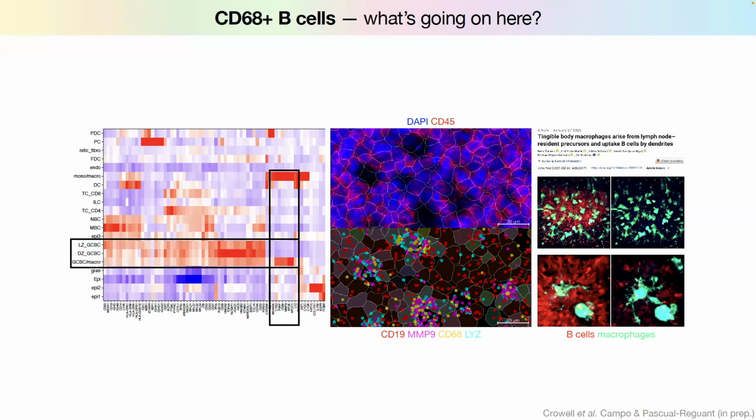But if you don't know about this and you only see this, what happens is that the transcripts are bleeding into cells that they don't belong to. So these macrophage genes that are being expressed are being assigned to the B cells after the segmentation. And then we get these weird mixture populations, right? And that's a problem because our clustering thinks this is a separate population, but in reality, those are B cells that are being infected by transcripts from macrophages that are eating them.